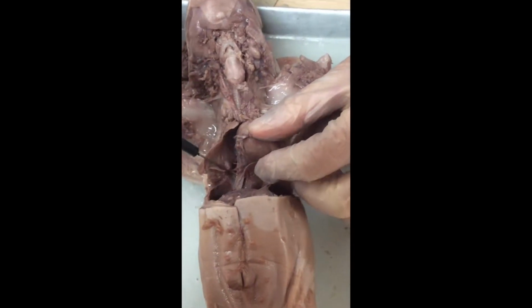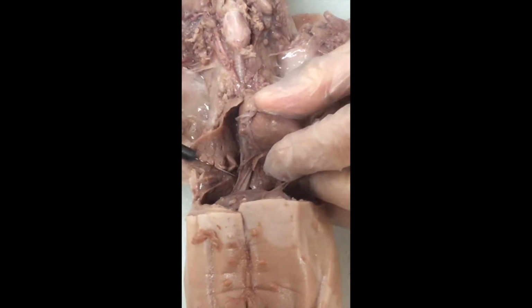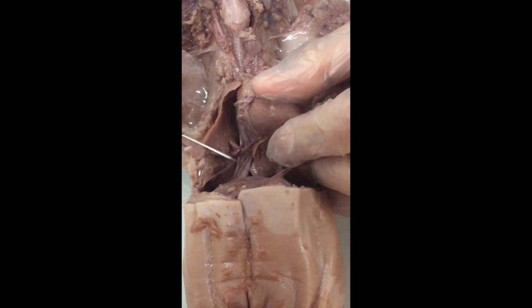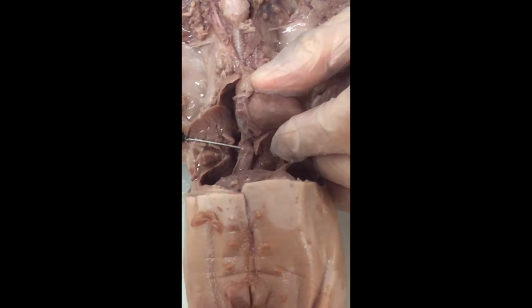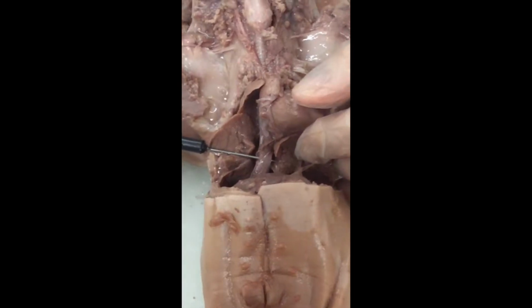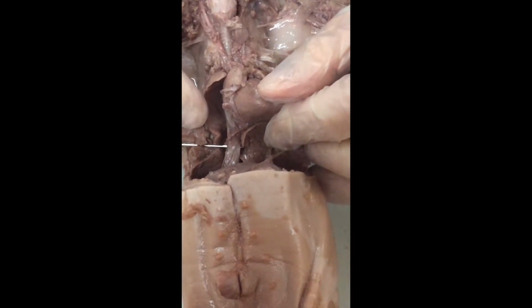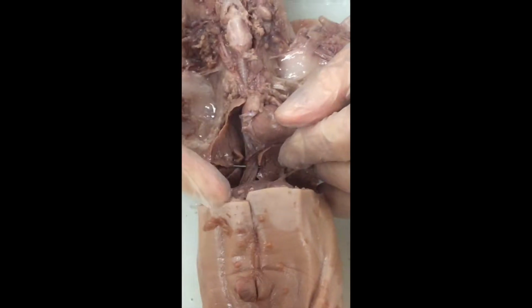We look down here on the caudal aspect of the heart, and we discover a pipe moving through the thoracic cavity right here. It's a very flexible pipe. That is the esophagus. And of course, that's a food pipe. The esophagus carries food and fluid from the mouth to the stomach.